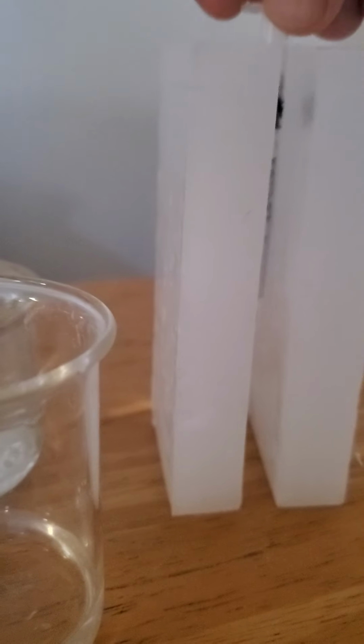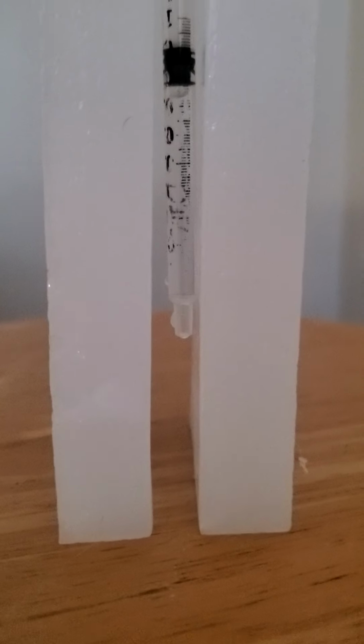Now I'm going to set it down in my little thing here. Now we're not ready yet, because here comes the hard part. You've got to use that surface tension to get just a little droplet, very good, to hang from your syringe. That's the tricky part, and I've been doing okay with it so far. You see that little droplet hanging from my syringe? That is going to be the lens of your laser microscope. You see that the little droplet is curved just like a lens.